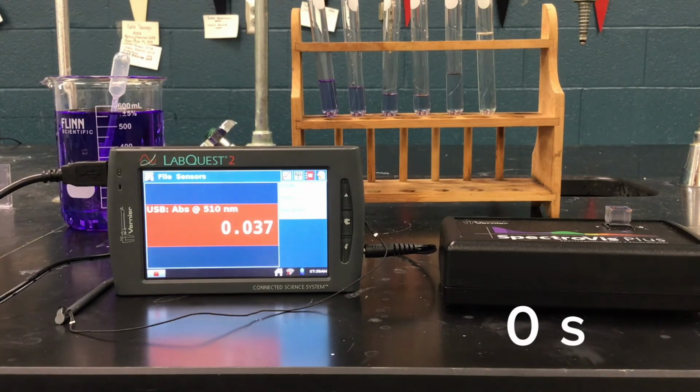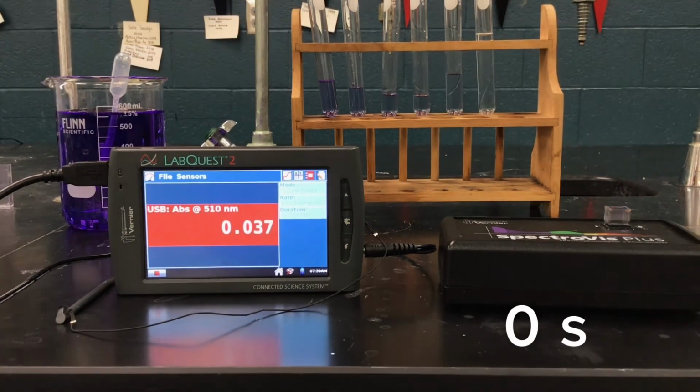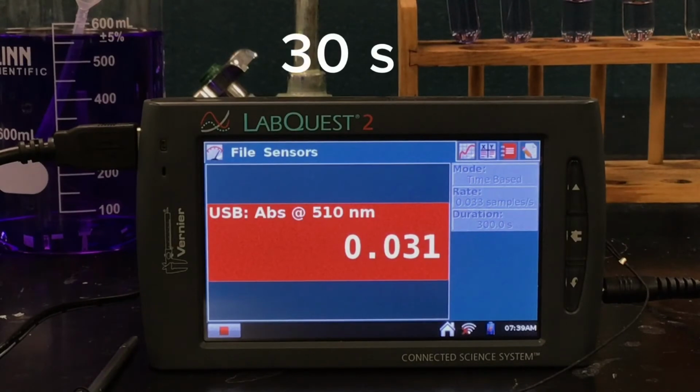Zero seconds, or the initial reading. 30 seconds.